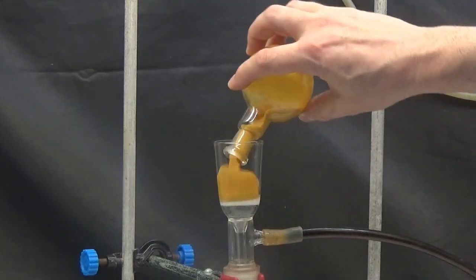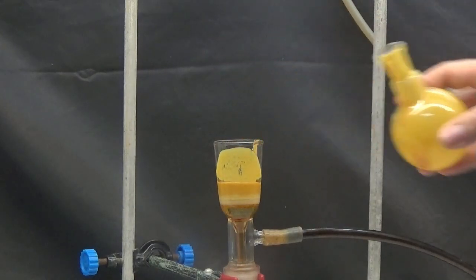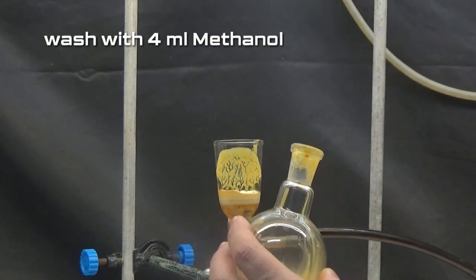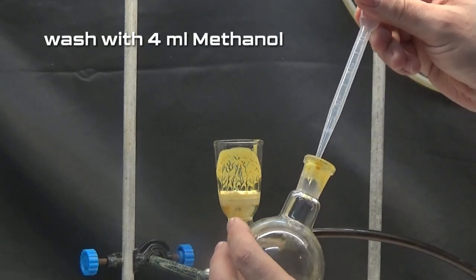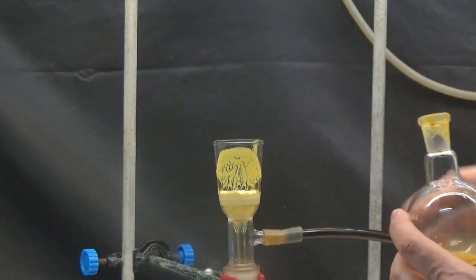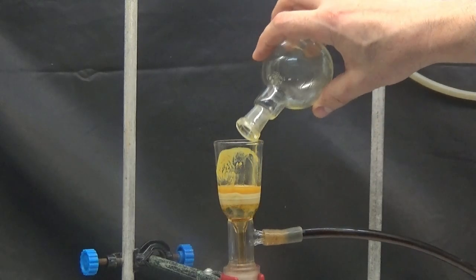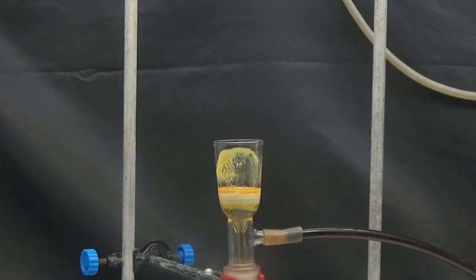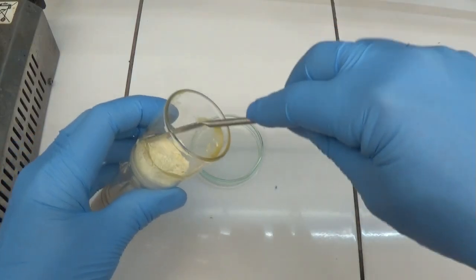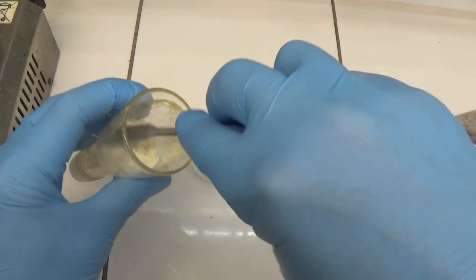When allowed to cool, a yellow solid is obtained. Collect the solid by suction. Wash the obtained solid with 4 ml of methanol. Dry the product in an oven at 60 degrees. Once dried, the final product is a yellow solid.